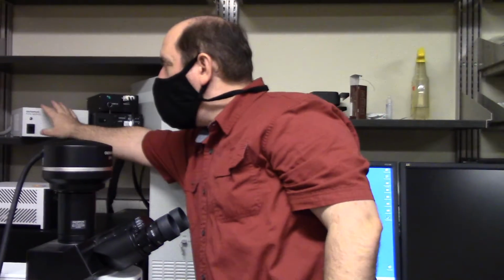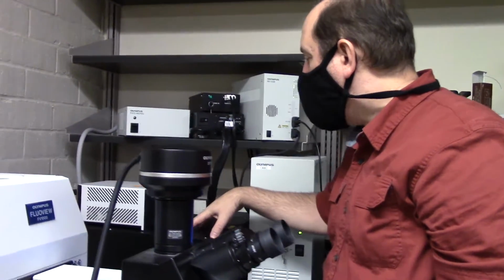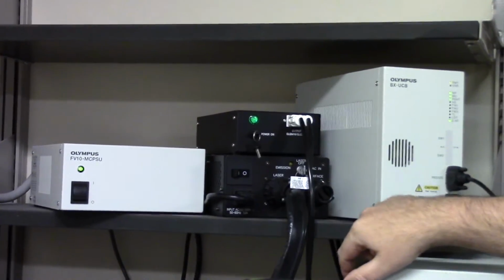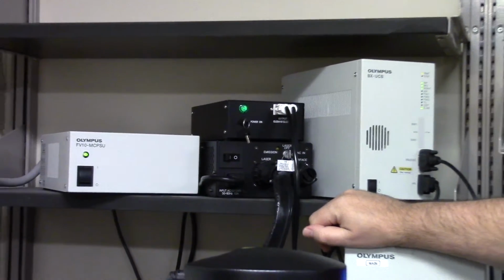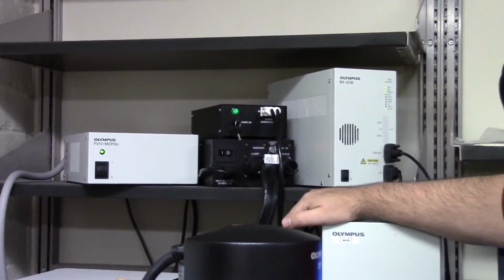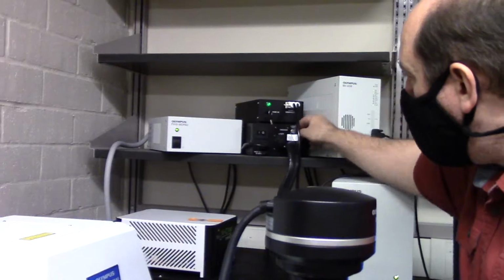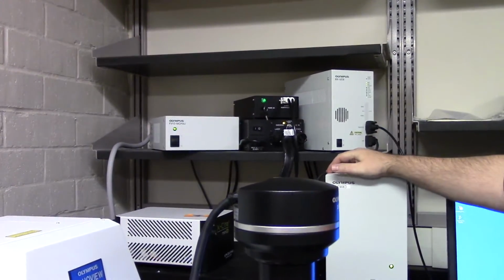The other thing I want to turn on is the lasers. These three are the power supplies for the lasers in the big black box here. So I'll turn on one laser, two lasers, and this third laser is the most energetic of them. It has a fan, or it would overheat. So I turn the power and the fan on. I don't know if you can hear that, but there's air coming out of the back of the lasers. And now I reach in here to use this key to turn the actual laser on.